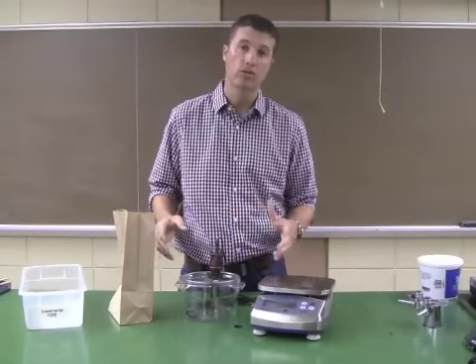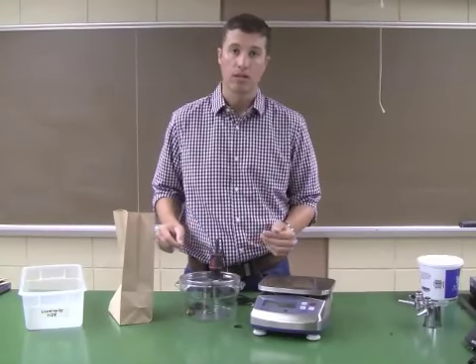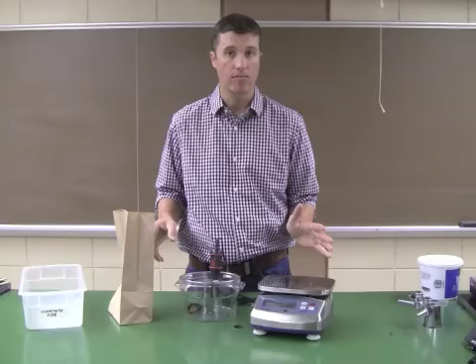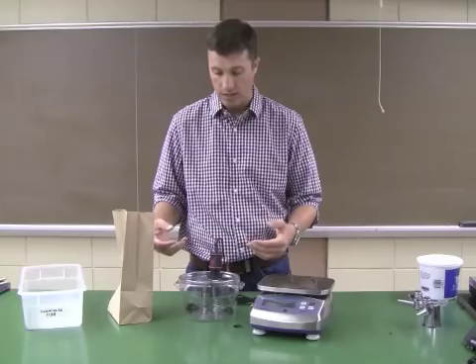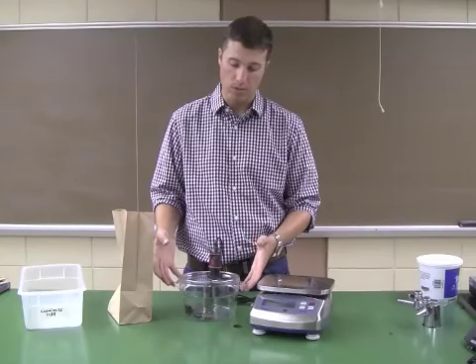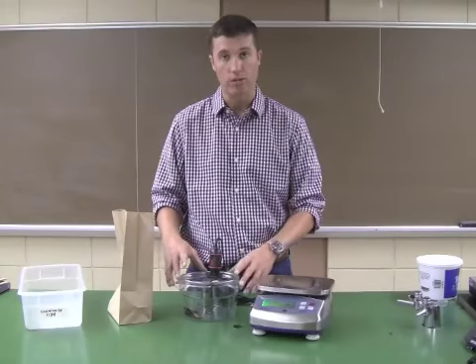Make sure you get your chamber to the temperature that you would like it for your experiment before you put the animal in there. You don't want to leave the animals in the chambers for any longer than necessary, because as they sit in here, whether it's hot or cold or room temperature, they're giving off CO2 and that gas is building up in here. So, you're doing just a 7 to 10 minute long measurement while they're in the chamber.